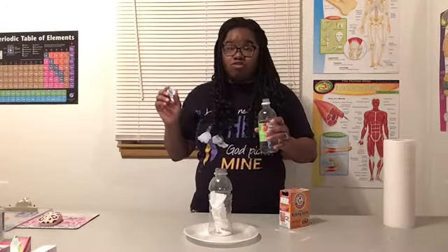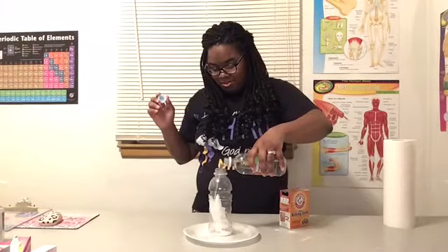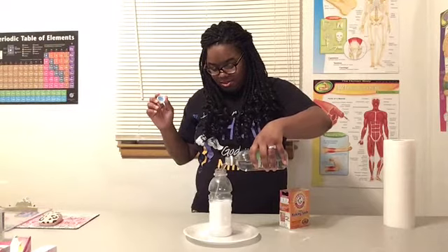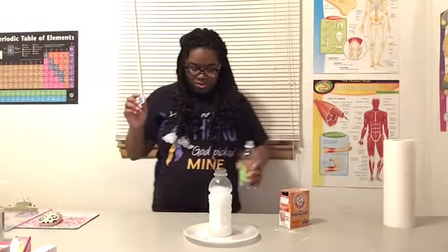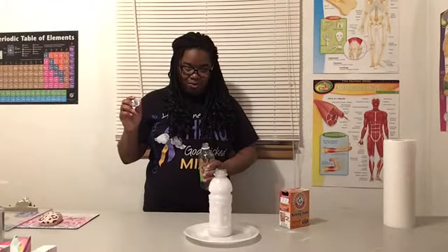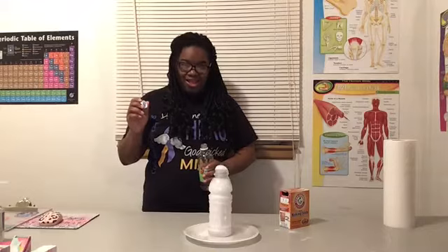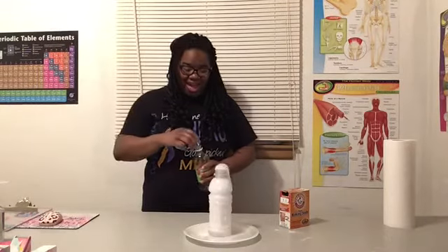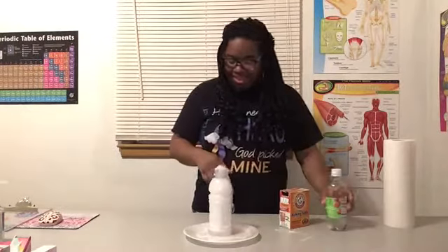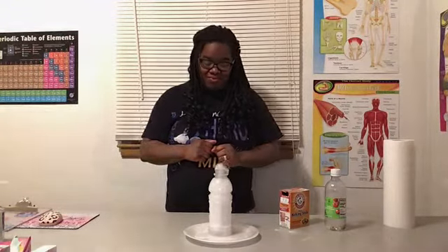Let's see, watch the magic happen. Look at that puppy go. Go, baby, go. All right. There you have it, our very own volcano.